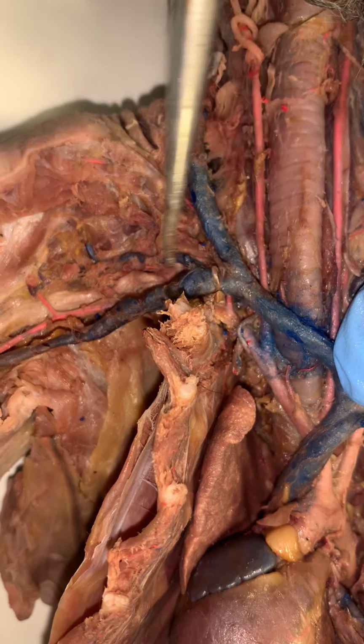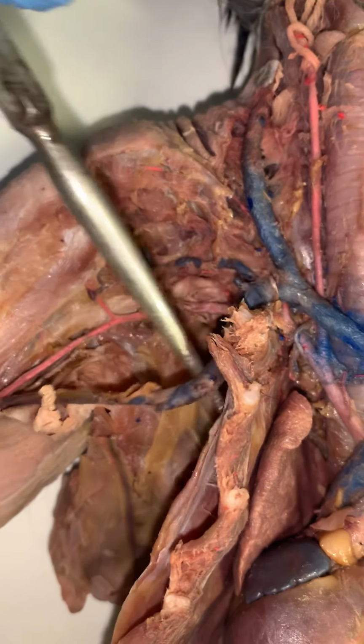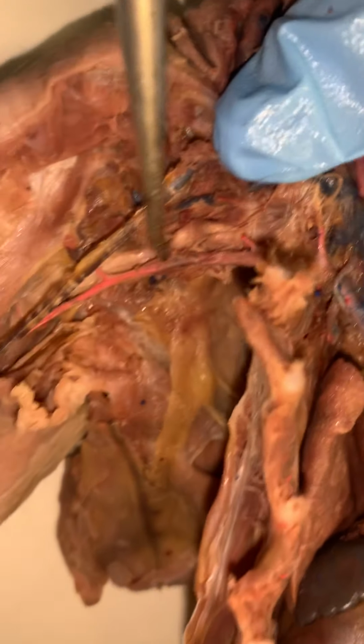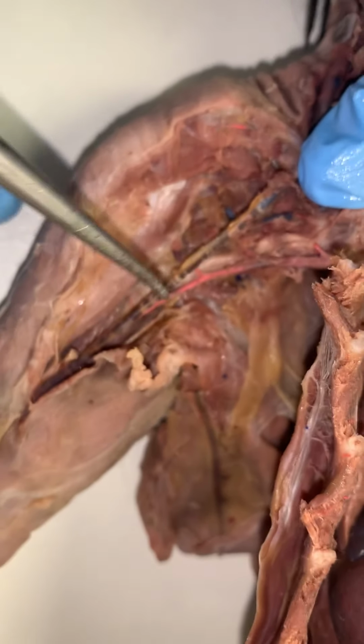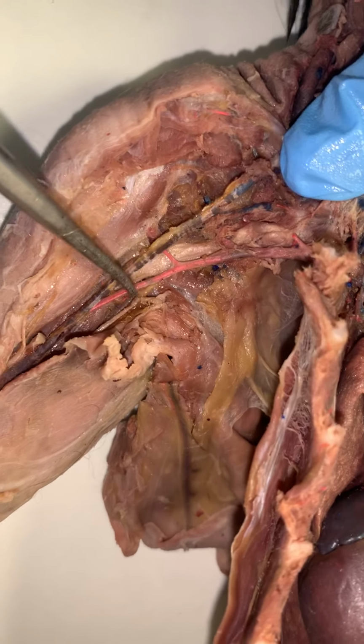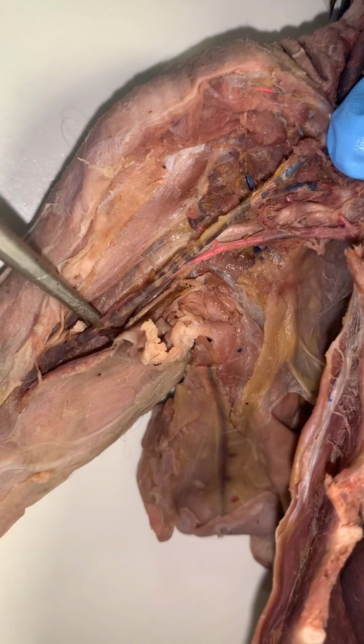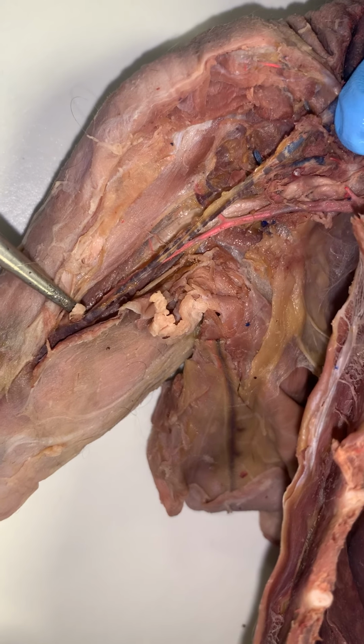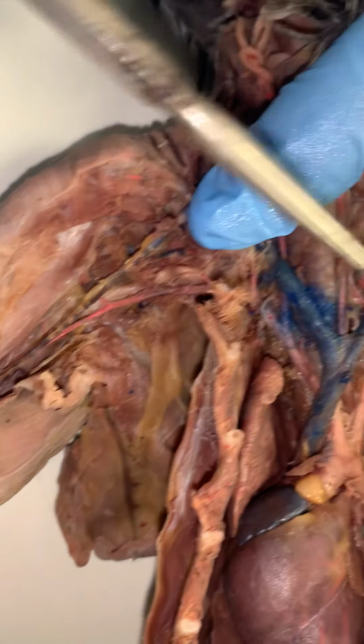It's going to go along to the armpit of the cat, right in through here. This is called the axillary. And then when it gets to the humerus, as it travels on down, you can see it again right here. This would be the brachial artery. And the same thing would be true over here on the right-hand side.